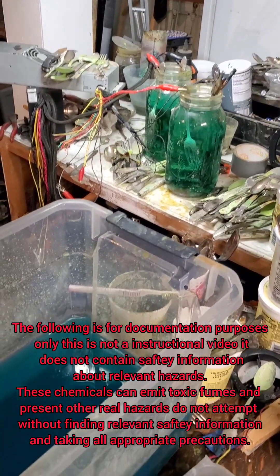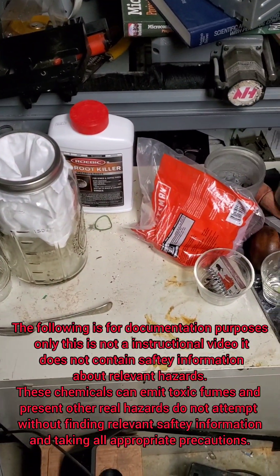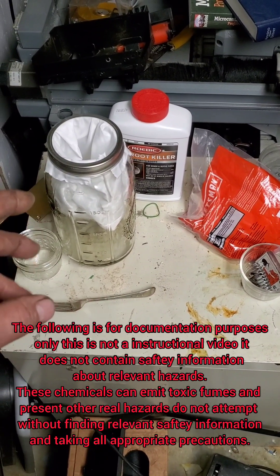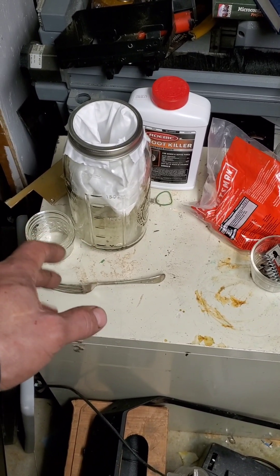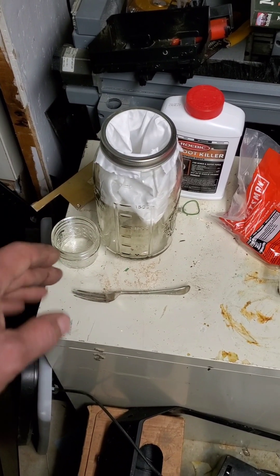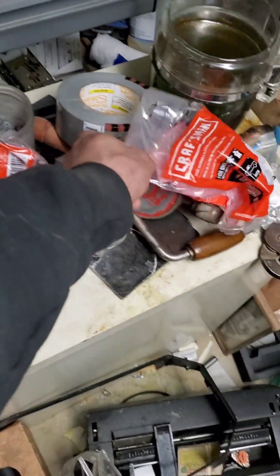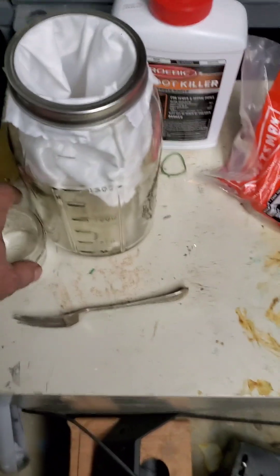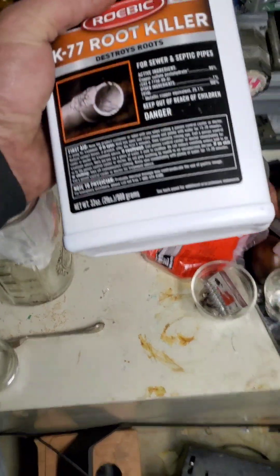Hey all, it's really cold outside and I'm bored. So I went and got some stuff at the hardware store today to try and make a copper cell. This is a setup that will take copper from one place and basically plate it onto another piece of copper in a pure form until the anode is completely dissolved, and then whatever's left over just stays in this little filter basket. I got this big old jar, and this is copper sulfate.